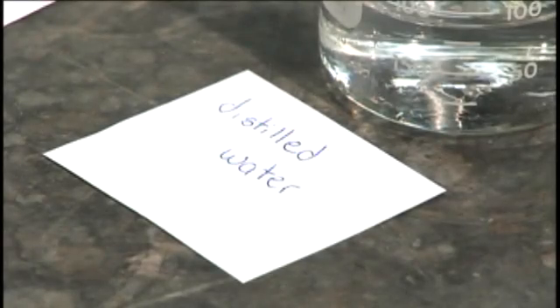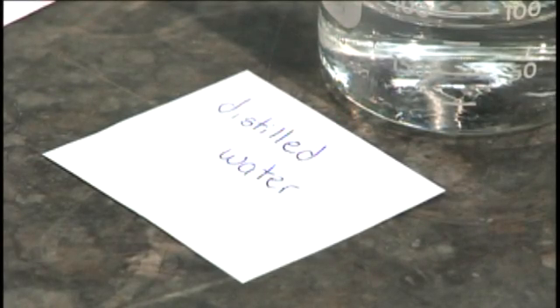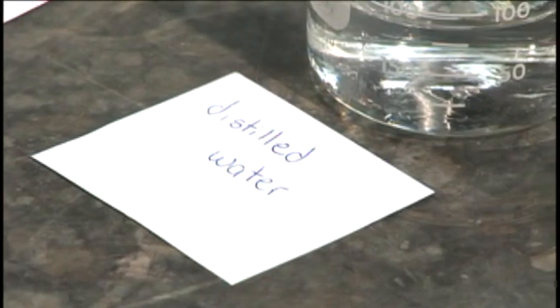In this lab, we're going to be looking at different factors that affect how fast a reaction will proceed.